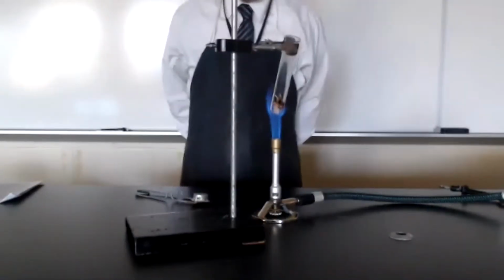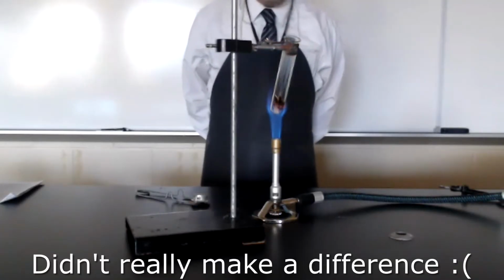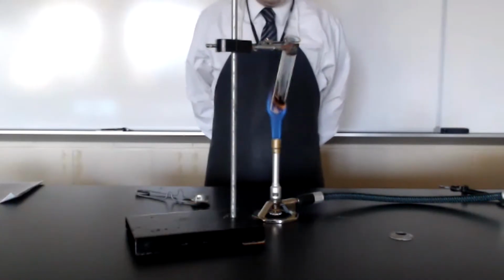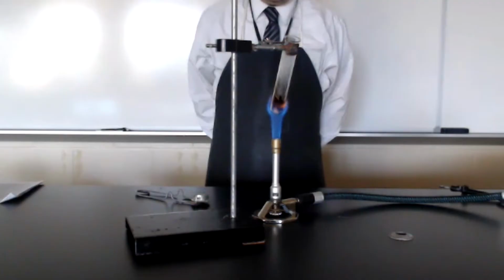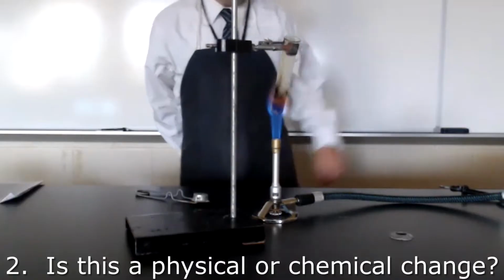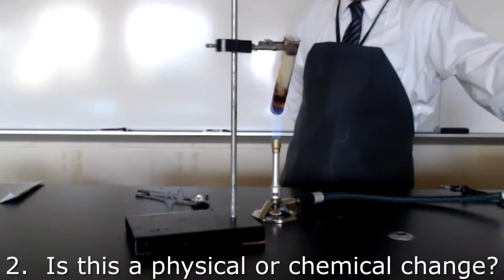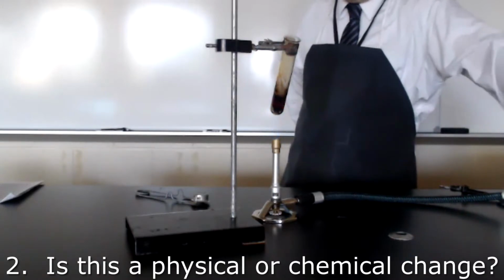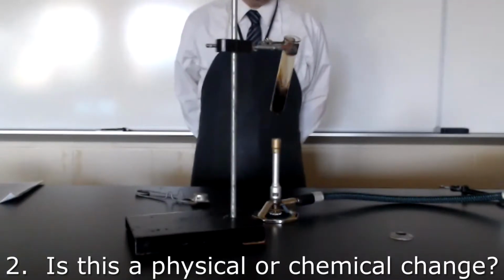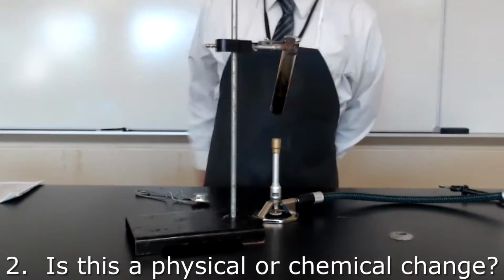Okay, I've turned off the light so that you can see this a little better. The one thing you'll notice is that the top has begun to smoke. The wood is becoming charred. At this point, the wood is mostly blackened. I am going to turn off the gas jet and allow the test tube to cool. At this point, the chemical reaction has stopped.